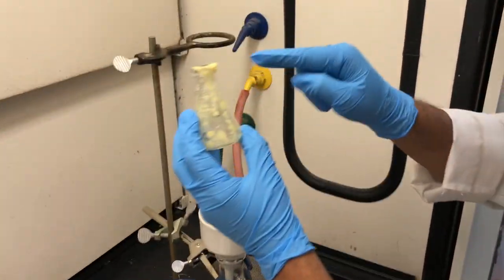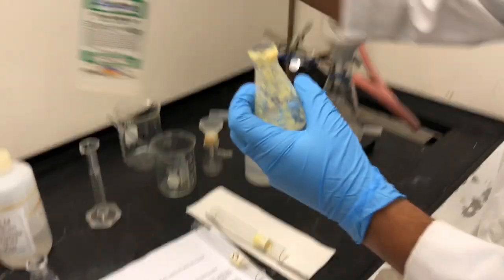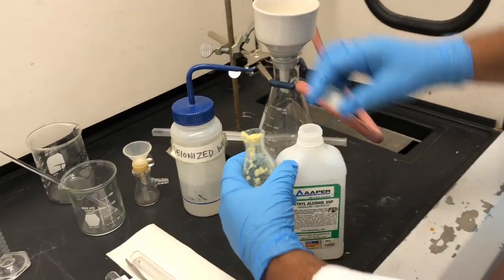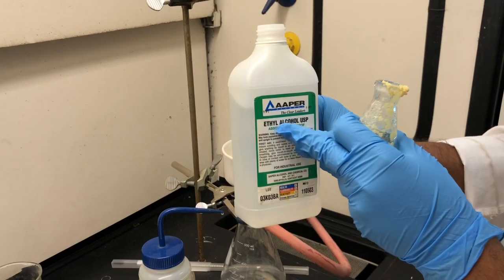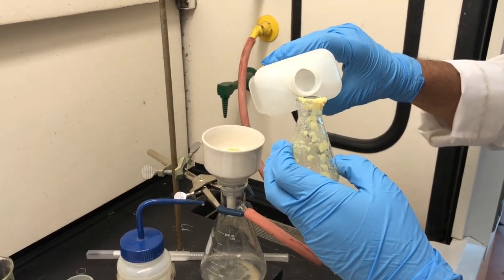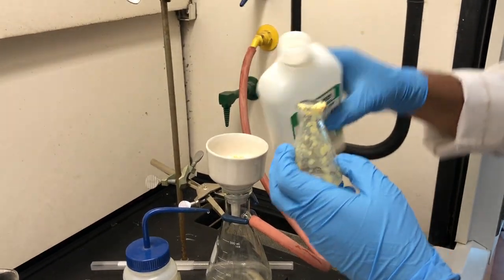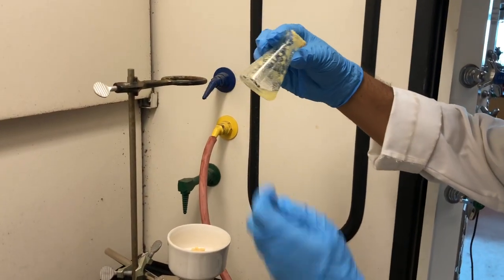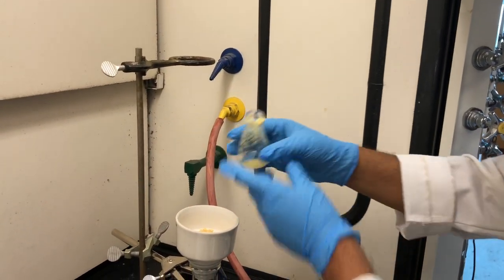So, to take out the maximum, you will be rinsing with few drops of ethanol. Make sure you don't touch your ethanol bottle to the flask. Otherwise, you are contaminating the whole bottle of ethanol. Now transfer.